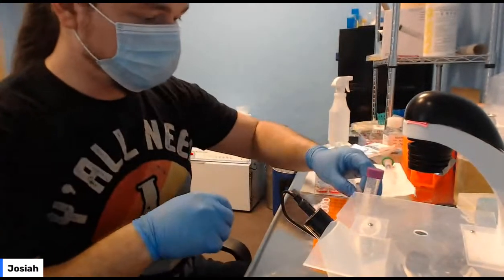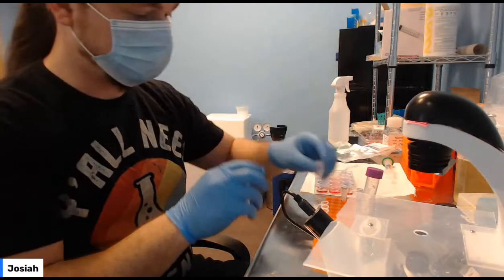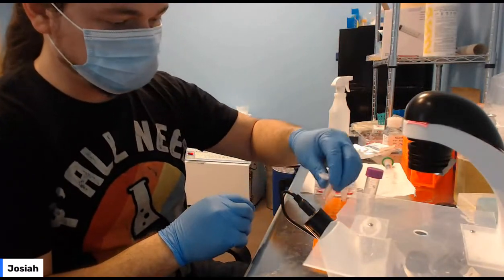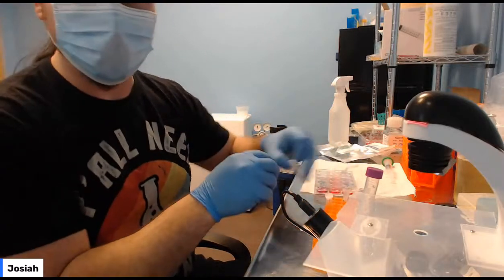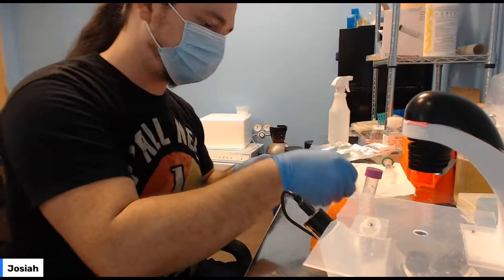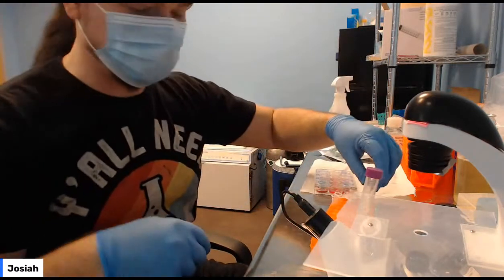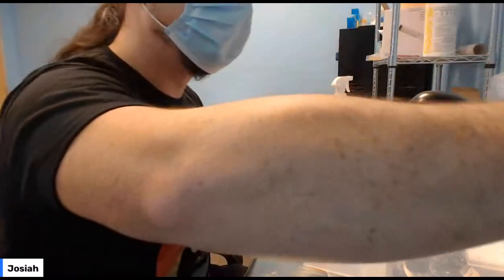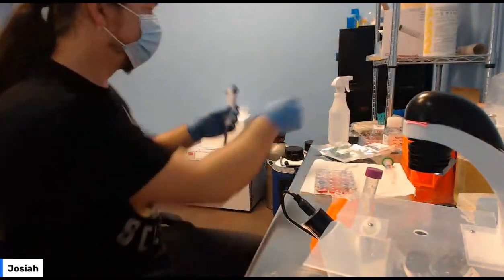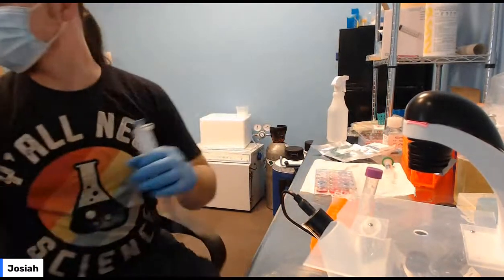So 2 of them have DNA, 2 of them do not have DNA. All right. So separate them a bit. I usually just put one on one side, one on the other. You can label them, whatever helps you keep track of it. Now we're going to get the calfectin. We're going to use 3 microliters, so we have to drop down to the even smaller pipette. 3 microliters can be hard to see.